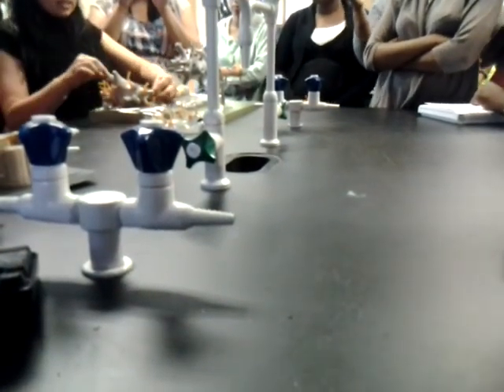Okay, so, second group. We have a multipolar neuron, which, based upon the shape of its myelin sheath and the fact that there's one nucleus per section, I know is in the peripheral nervous system. So it would be a motor neuron and a multipolar neuron. Let's start with these sections.